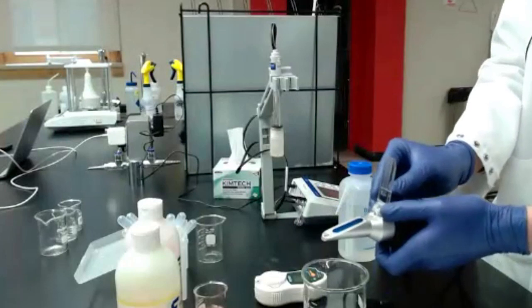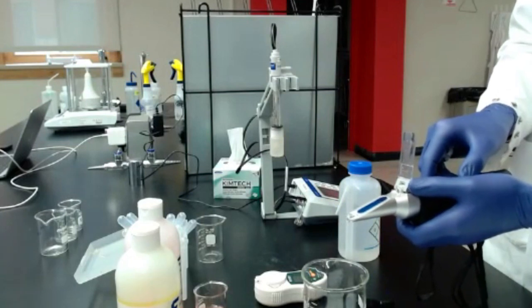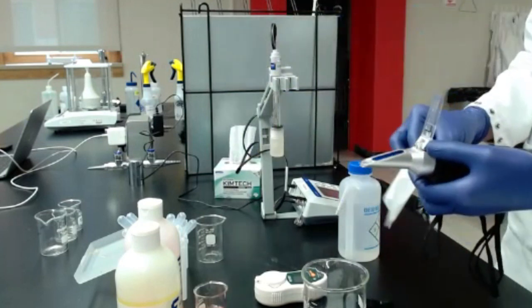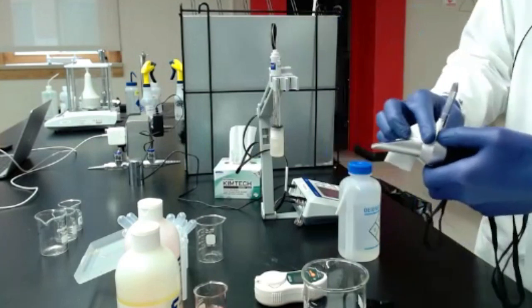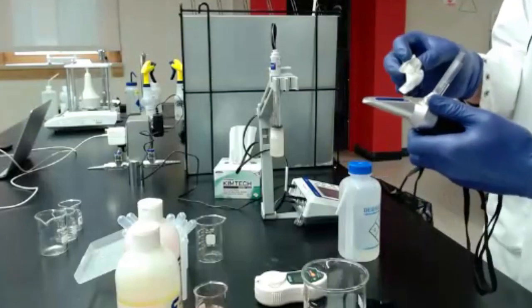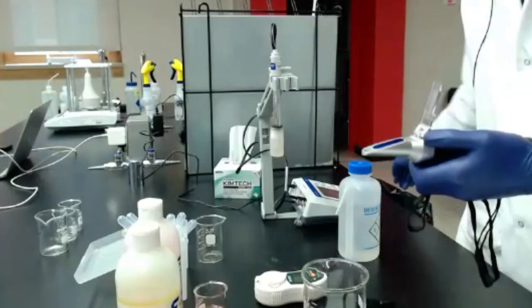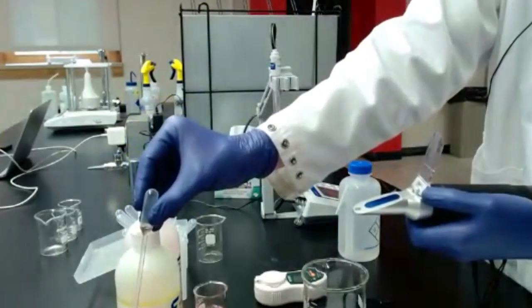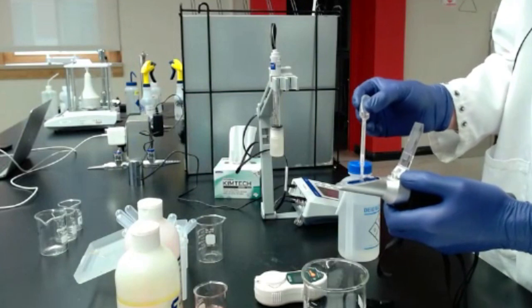Does anybody have issues calibrating their refractometers? Any questions on that first step? No? All right, I'm going to go ahead and dry off the lens again. Make sure it's nice and clean, both parts. Make sure to dry off the cover as well. Once we put our sample on there, we don't want to dilute it. And then we can proceed with our transfer pipette. We can take a little bit of juice and cover that whole lens with the sample.